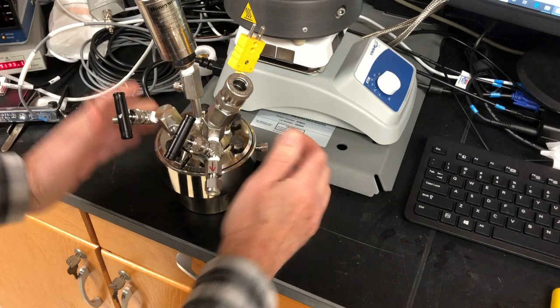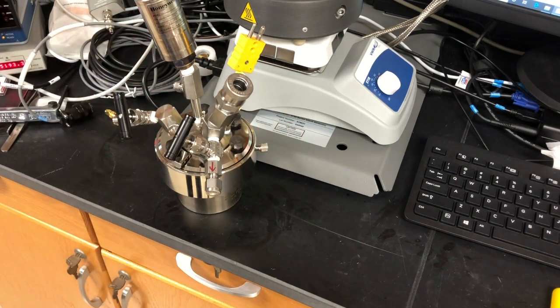Install the retaining ring, align the ring's bolt with the indent in the holding ring, and hand tighten.